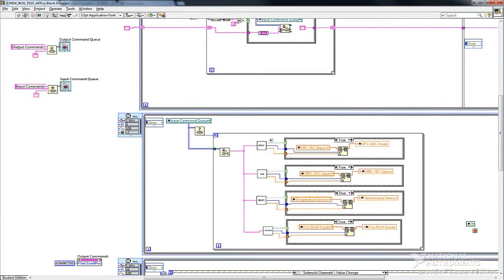Then I just have another loop that scans the input command queue and then decodes what's in there. Each one of these sub-VIs is programmed to look for a specific string, for example, the temp string, the 4 to 20, and grab the data.